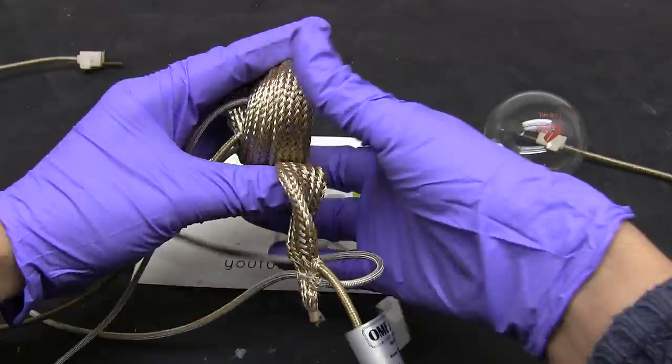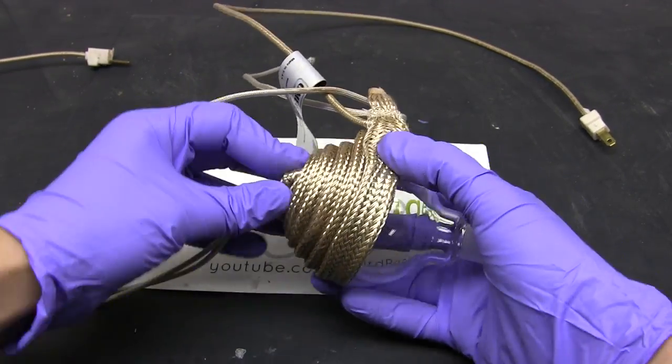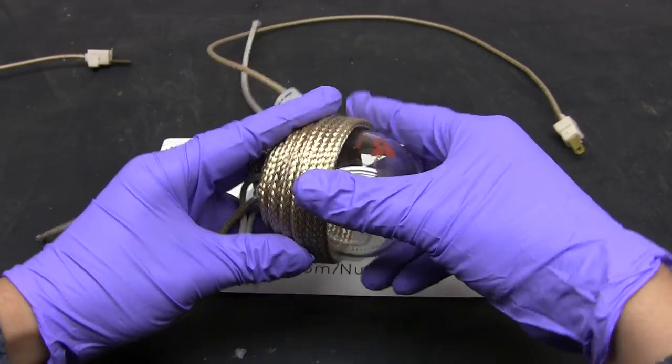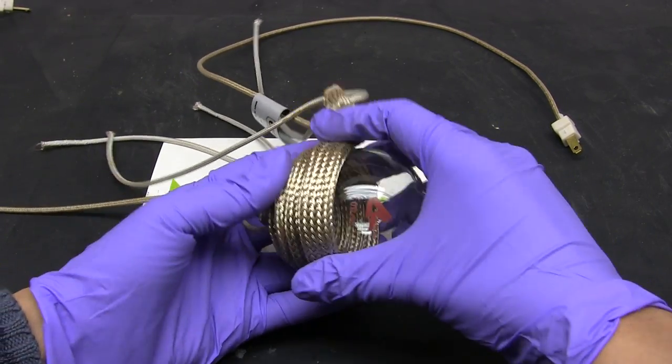Wind the tape into a roll. Now take the flask and mold the roll against it, creating a cup shape that fits the flask. Pat the heating tape if you need to, to ensure the cup is neat and has good contact with the flask.